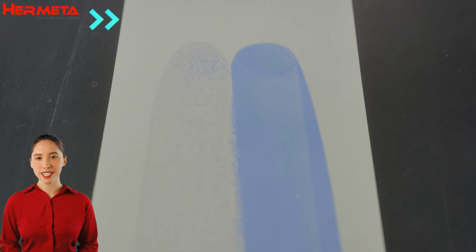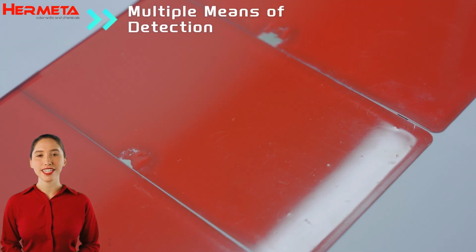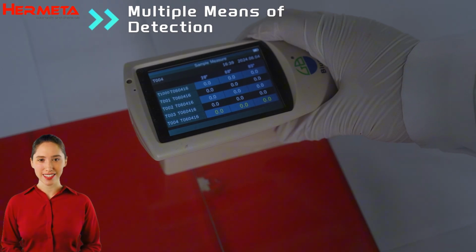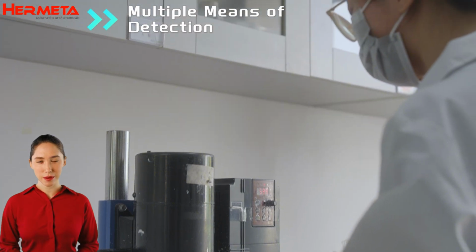The data from each experiment is the key to improving the quality of our products. Through fine-grained data analysis, we continuously optimize our pigment formulations to ensure that we provide our customers with products of the highest standard. Quality testing is our last line of defense for the quality of our products.